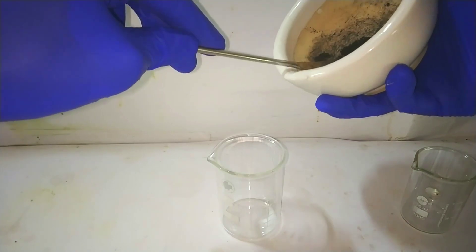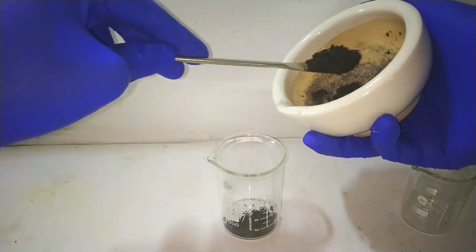Once that is done, we transfer the compound to a 100 milliliter beaker with a spatula.